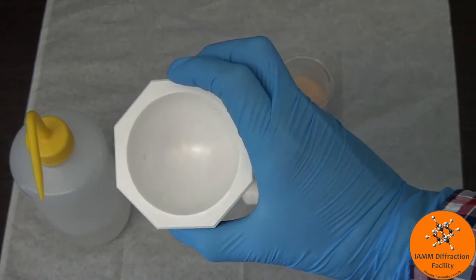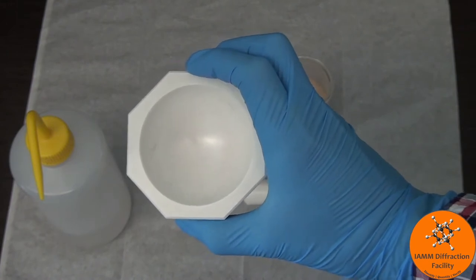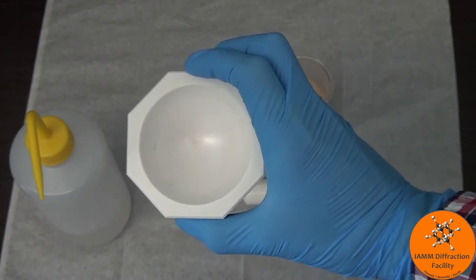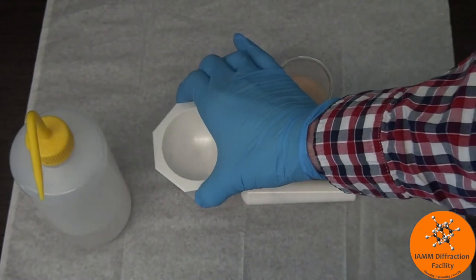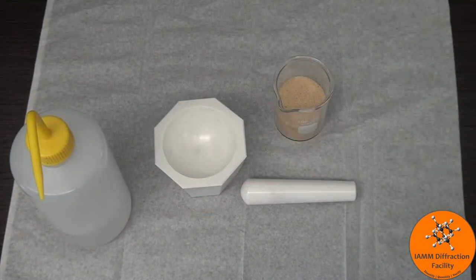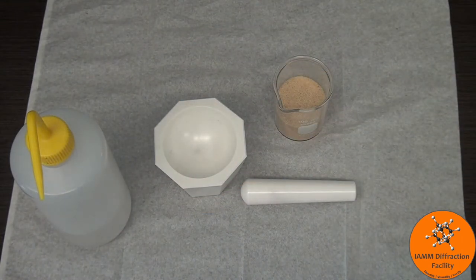So if you find out that you have these marks still in your mortar and you just can't get rid of them, then please do this so that it's clean for the next person that comes in.